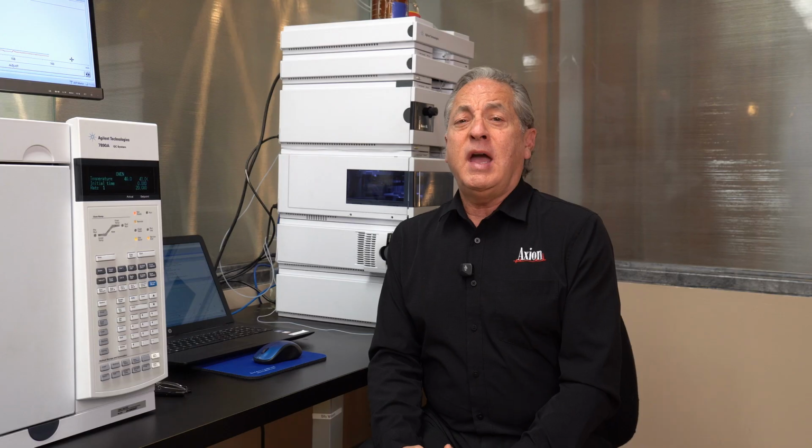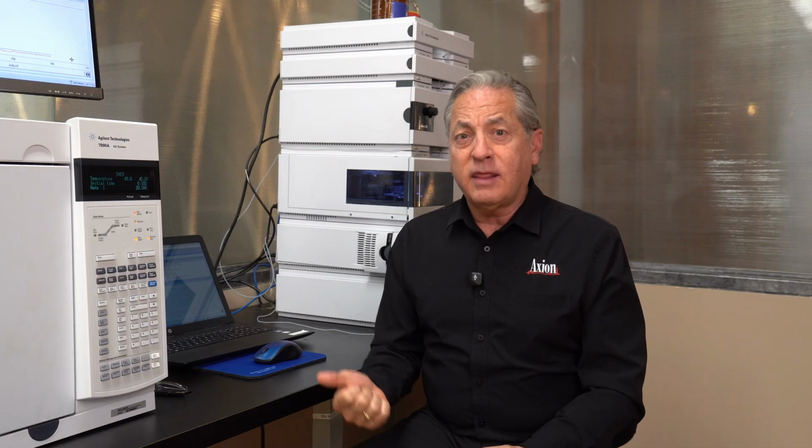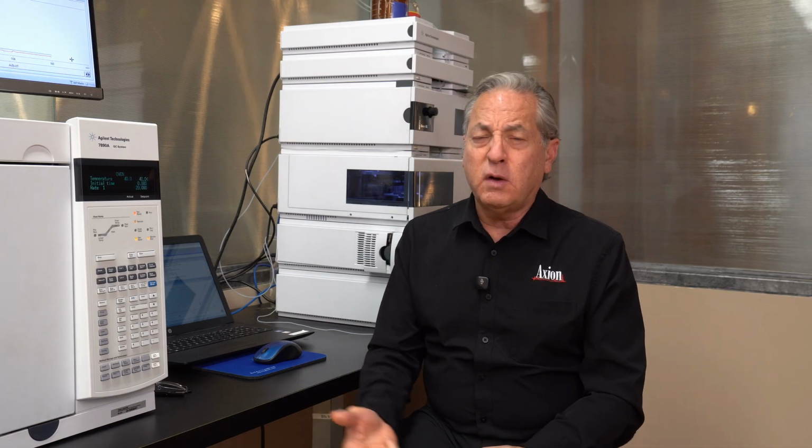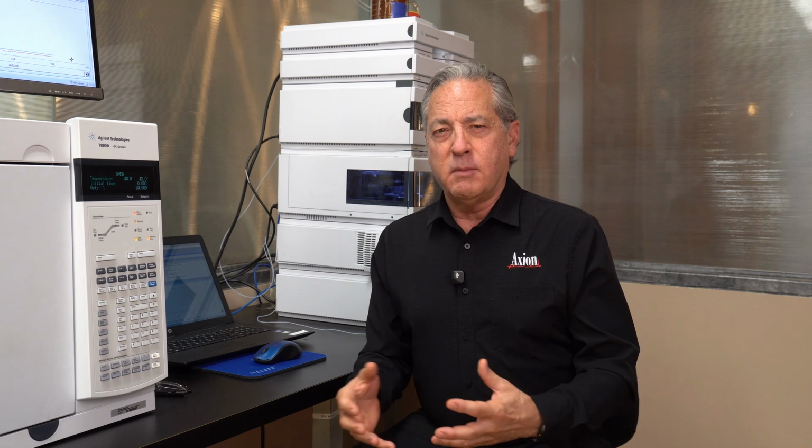Method development is supposed to be the most complicated thing in our field because it means coming up with a recipe. Most people look at a GC recipe and they probably try and figure out how would you come up with those conditions, because we have to choose the right column length, diameter, film thickness, stationary phase, temperature program. But of all those things, it turns out that the temperature program is probably the most powerful.